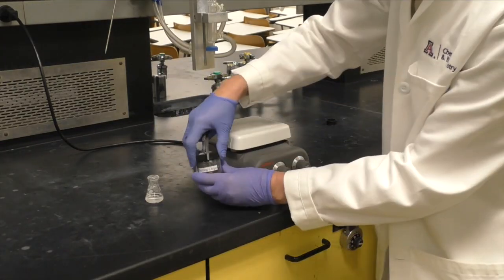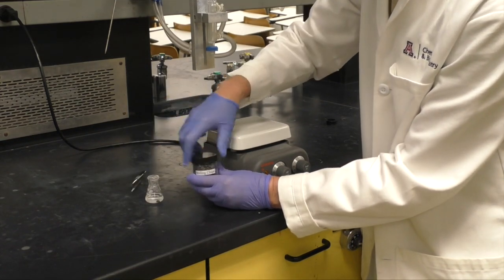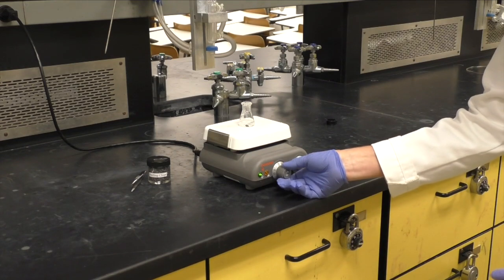Add a stir bar and 1 to 2 boiling chips. Heat the solution with stirring until the mixture boils.